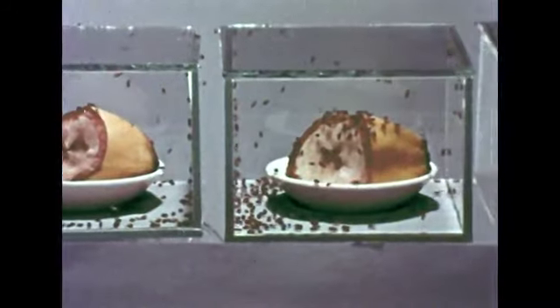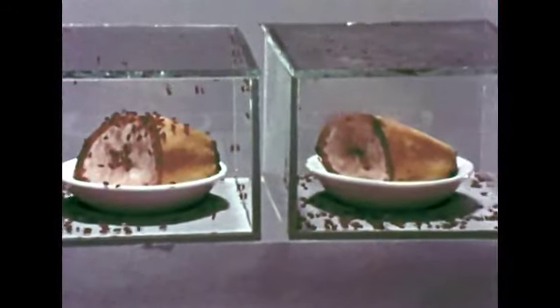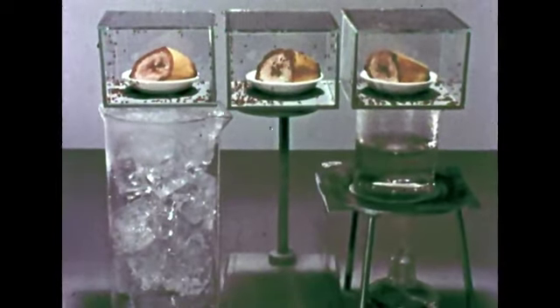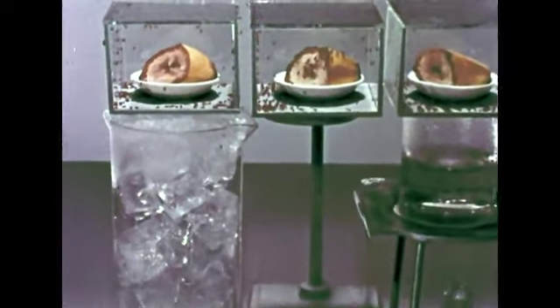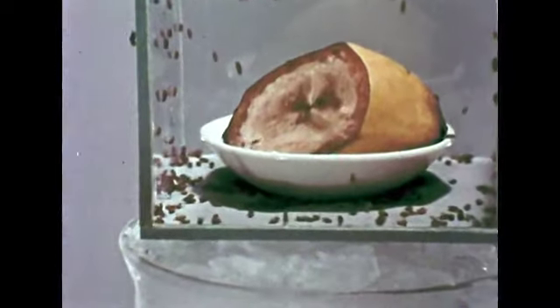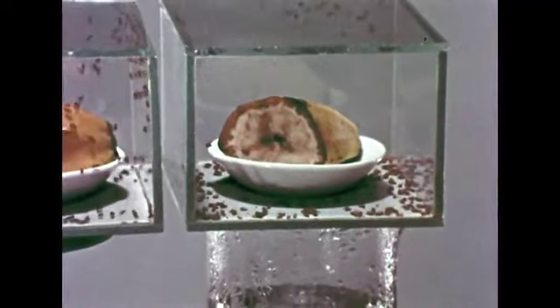The flies in the middle box also seem more active than those on the right. When we remove the board, we can see that the containers are kept at different temperatures. In the box on the left, being kept cold, very few of the flies are moving. In the container that is heated, we can see almost no motion. What about the middle container? It's at room temperature and seems to provide the best environment for the flies.